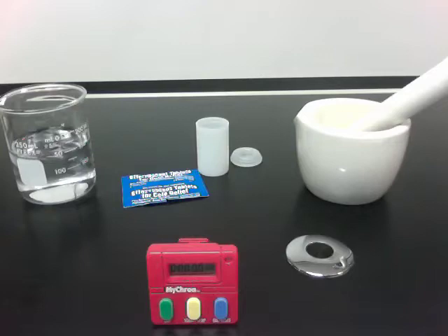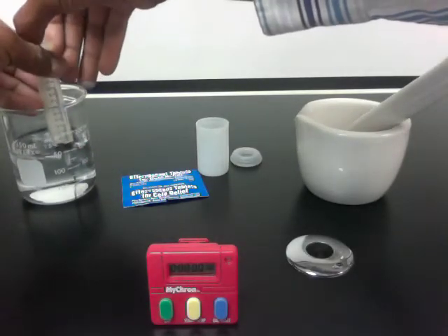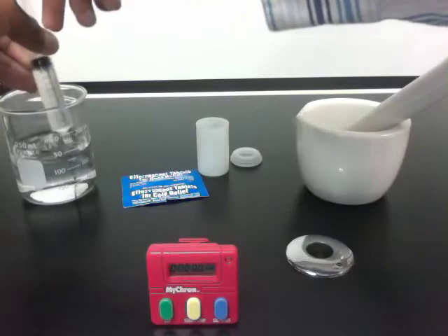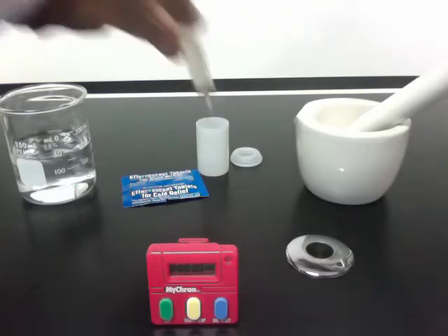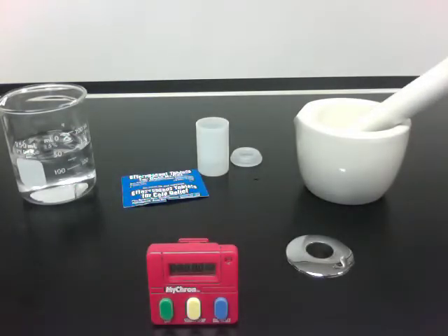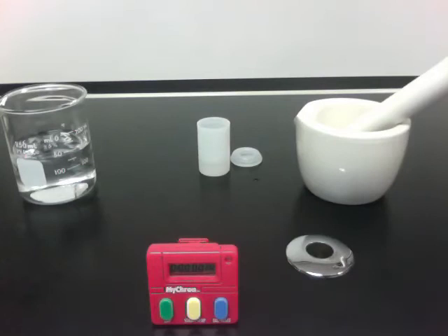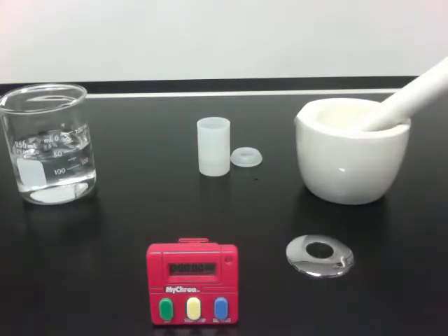I'm going to start by placing 10 milliliters of water into the film canister, using a syringe to draw up the water — so 10 milliliters. I'm going to take one of the two effervescent tablets, put it into the film canister, and then cap it.